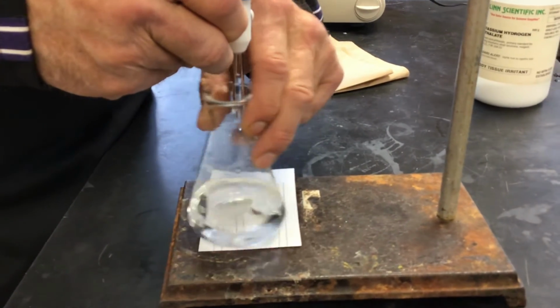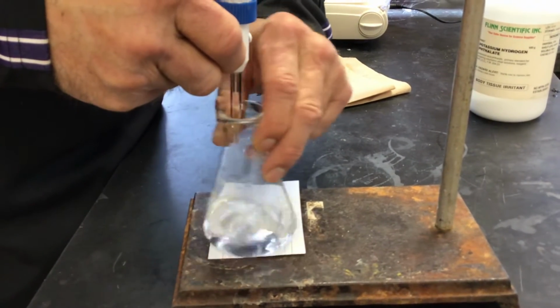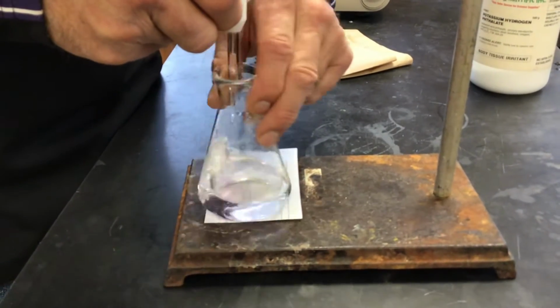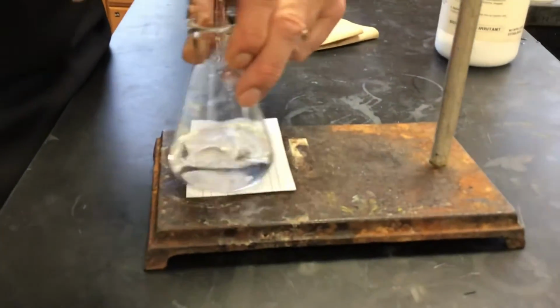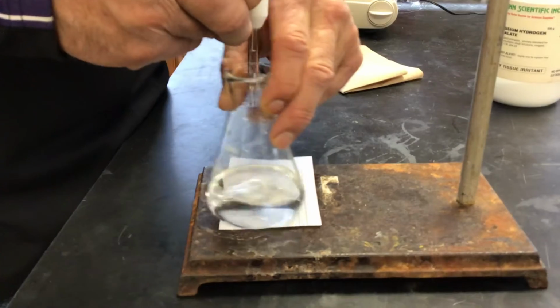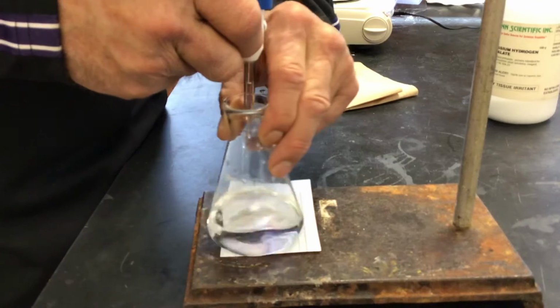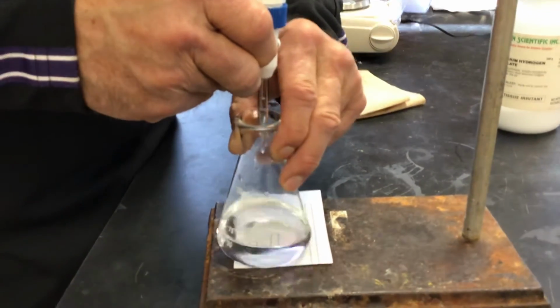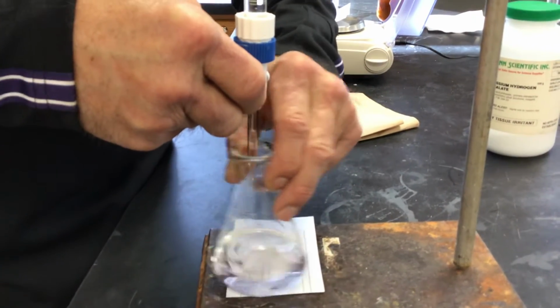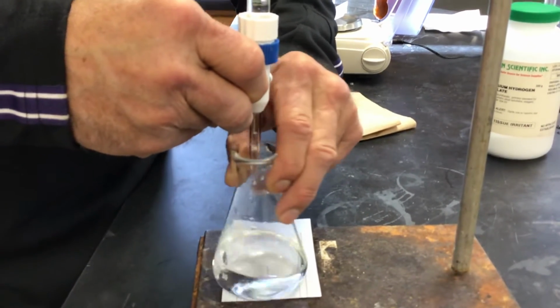We're as close as I thought we were. I got lucky. Okay. We're still getting there. I'd like to portray it as skill, but it was absolute pure luck. It's not luck. And you can't really appreciate this until you do it yourself, how finely you have to turn that valve. I mean, just a very small amount makes the difference between whether you get 1 drop or a whole stream of liquid coming out of it.